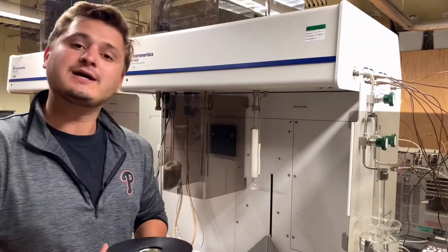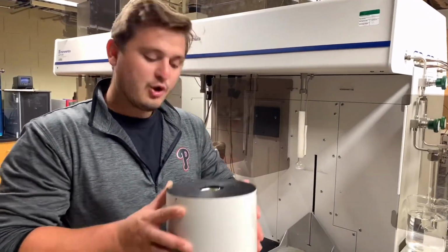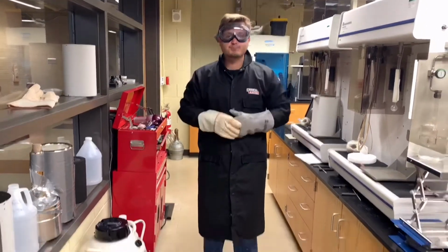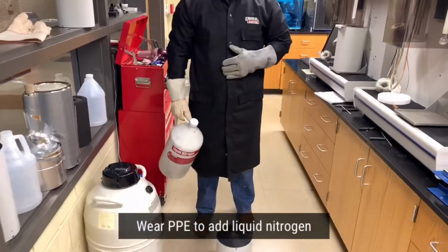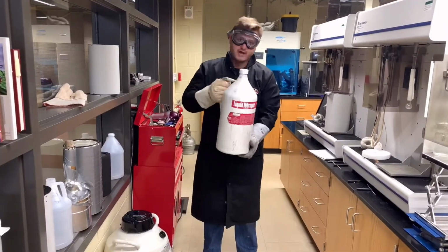We are using 77 Kelvin, or liquid nitrogen temperature. So we will be filling our dewar with liquid nitrogen. So now that we have the proper PPE, or personal protection equipment, on, safety goggles, gloves, and a lab coat, we can now fill our dewar, or liquid containment vessel, with our liquid nitrogen.